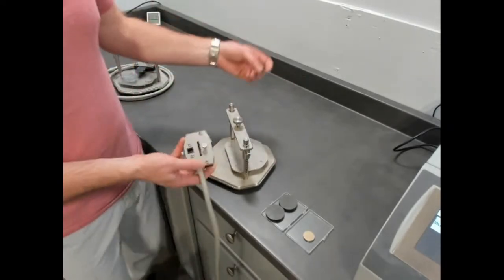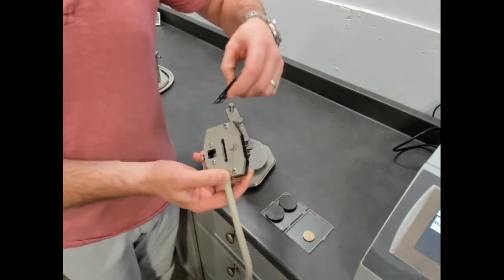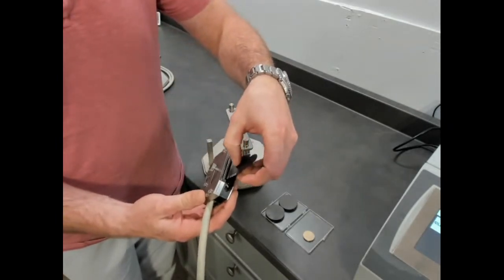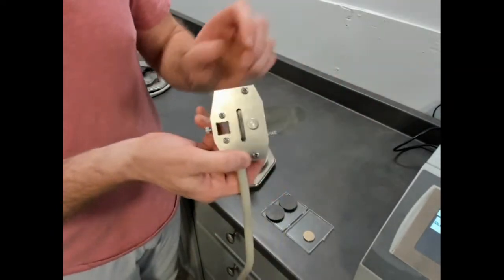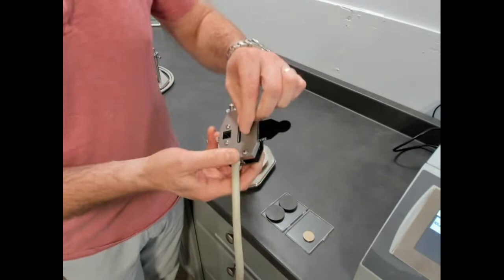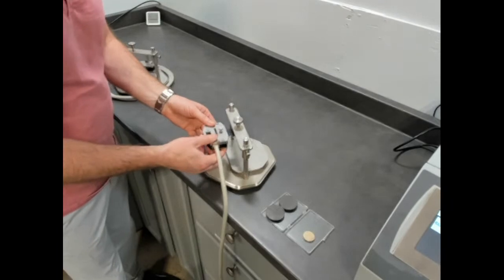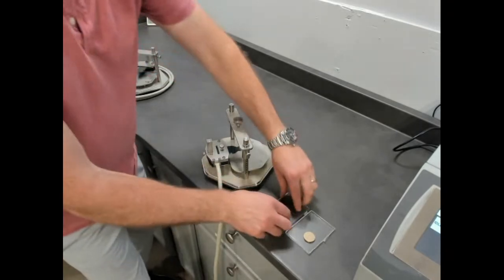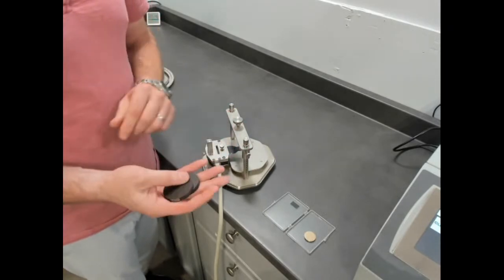So I don't normally have to do this, but for demonstration, we'll show this is your 4 contacts. There's an insert location and a plate that we lower to create electrical contact. We just slide that in, and you can see there's a window. That window is when you know you have good contact, and then we just turn that, and that gives us our sensor setup. And we place it on the adapter bar, and that's how we account for change in height between sample sizes. So in this case, the demonstration that we're really describing is composites and polymers.